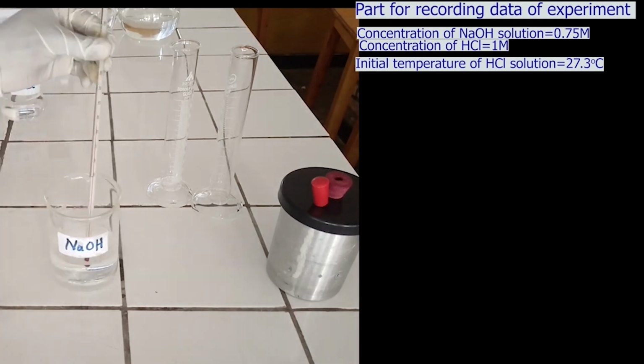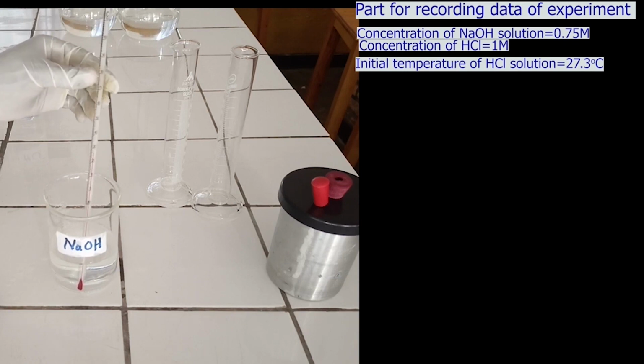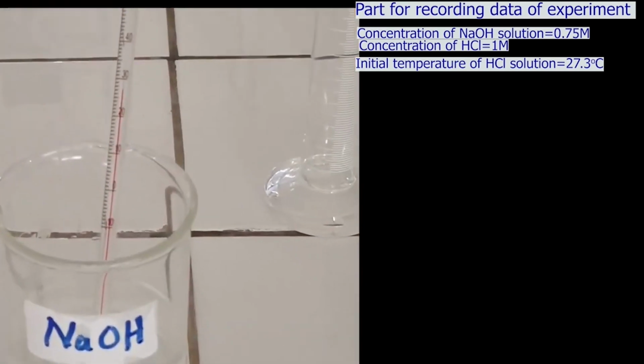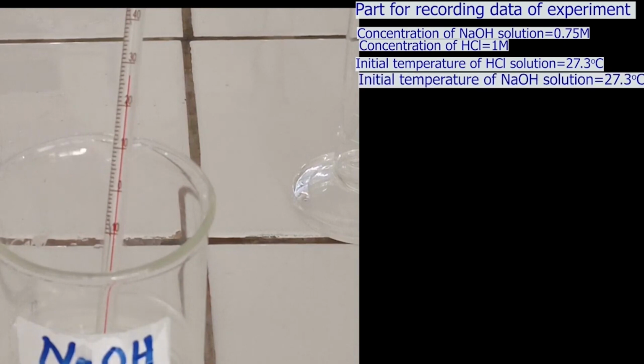Measure the initial temperature of sodium hydroxide solution. Read carefully on the thermometer. The initial temperature of sodium hydroxide solution is 27.3 degrees Celsius. Both solutions, acid and base, are at the same temperature, 27.3 degrees Celsius.